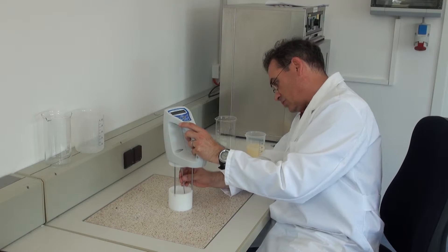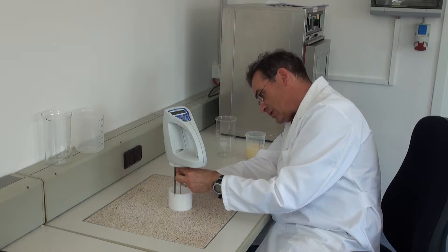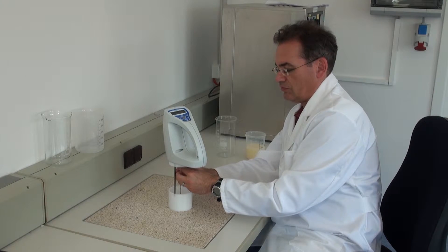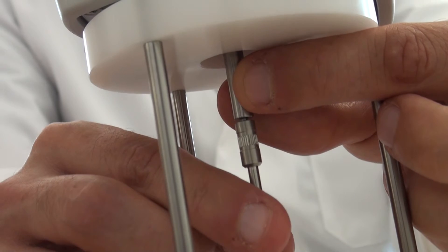And fix from underneath the rotation body by screwing it to the rotation part. For this I turn the rotation body against the clock.